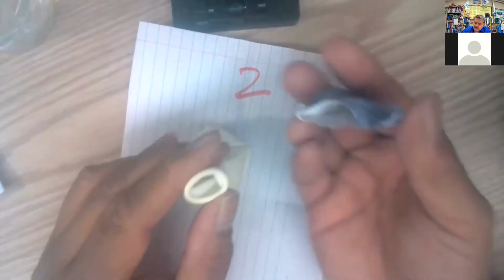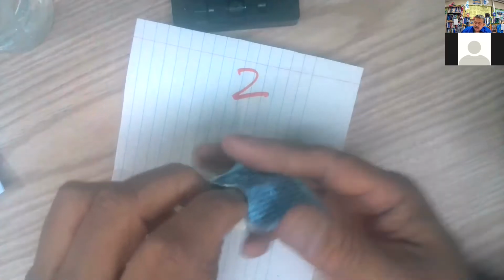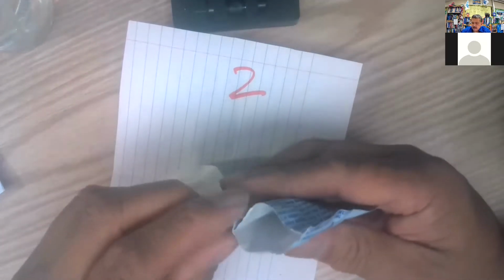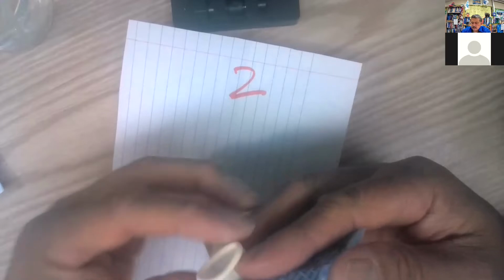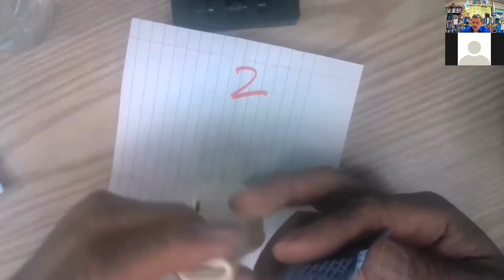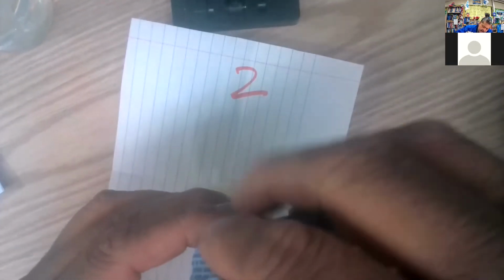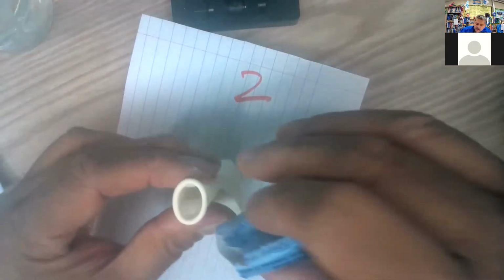Still getting the rest of the powder in. You see there, I got just about all of it. I'll try to get everything because we want to minimize the variables, right? So I'll try to make everything the same as much as you can. So we're going to try to get all that powder in there. Even though this is a qualitative lab, we still want to minimize the variables in a scientific experiment. So still coming out. Oh yeah, I can still see it. So keep trying on that.